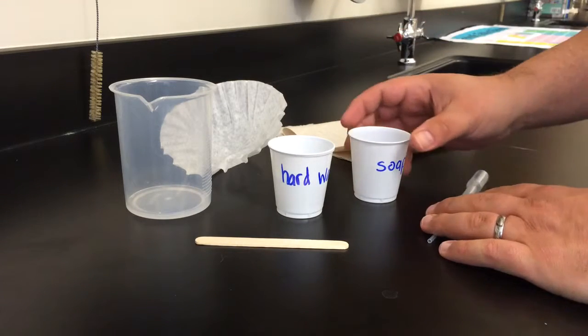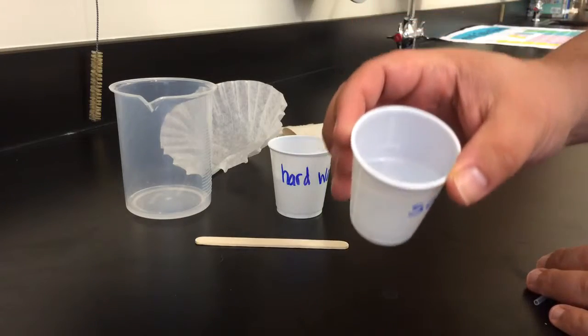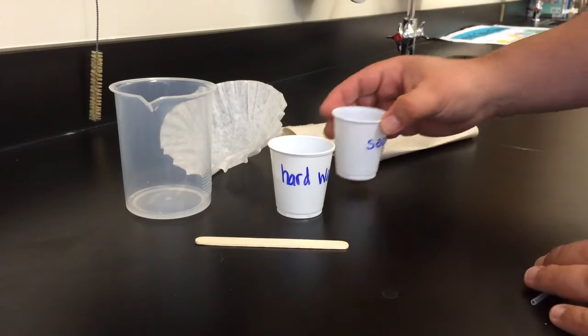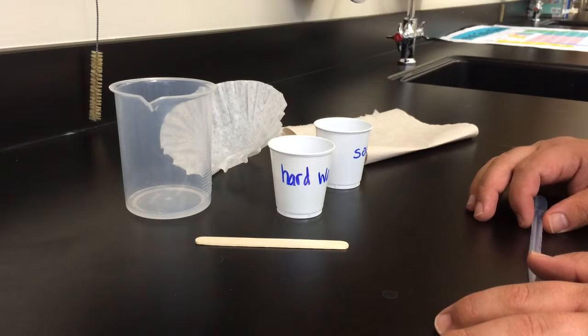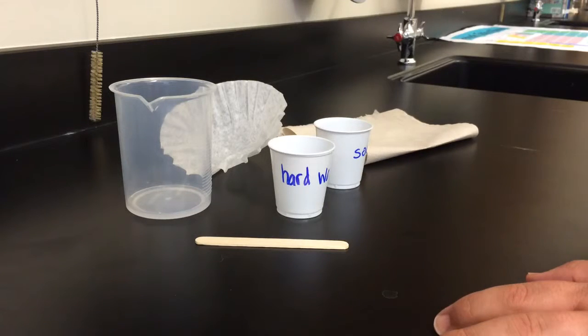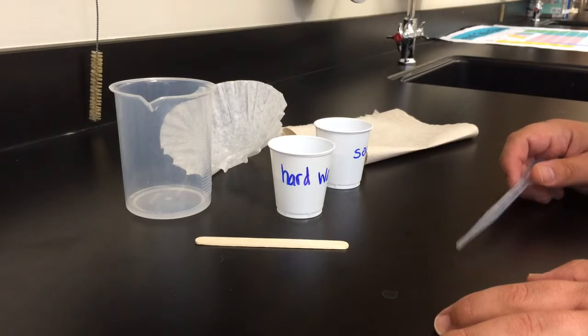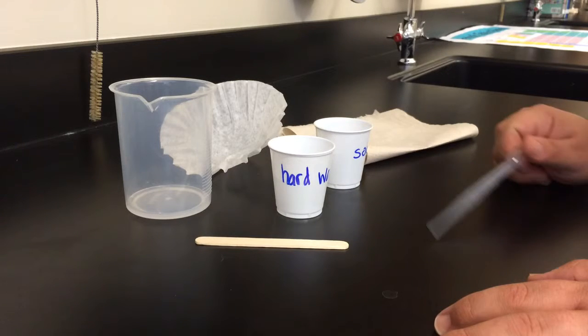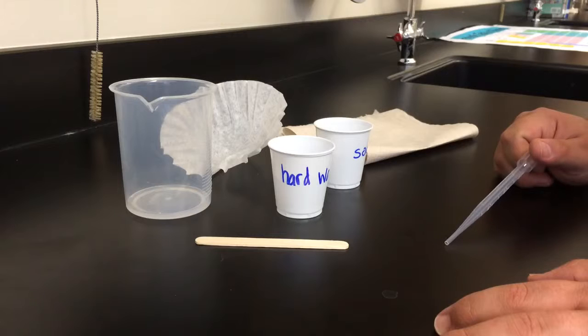Now the first thing I want to point out is that it's impossible to have the soapy water without pieces of soap in it, so we're gonna try really hard to move soapy water into the hard water without taking any of the pieces with it. And that's the entire reaction by the way. Everything else we're gonna do for this lab is what comes after the reaction.